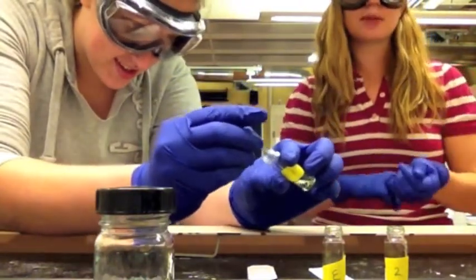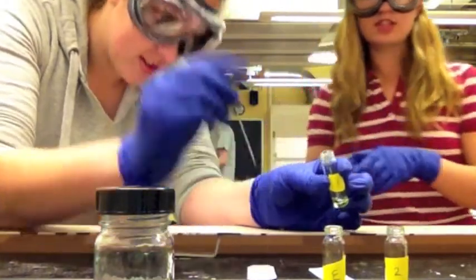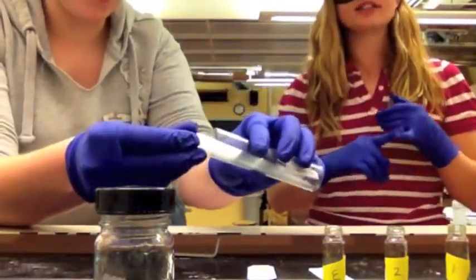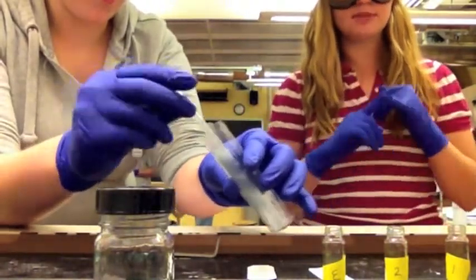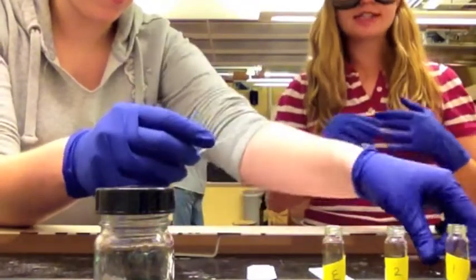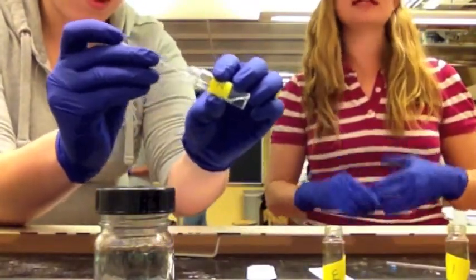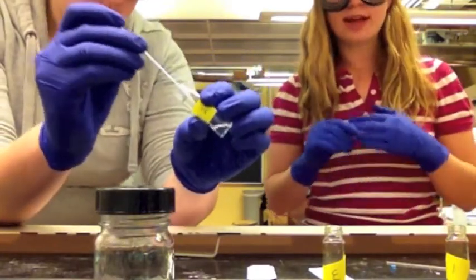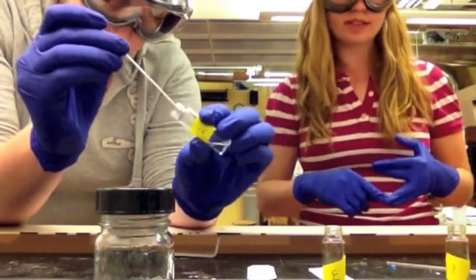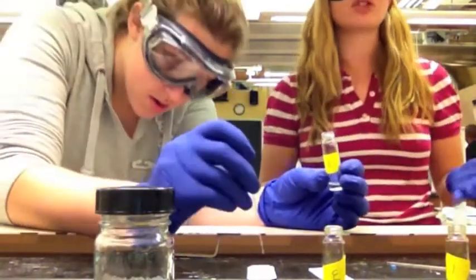This procedure can be repeated for all three samples. So, while she is finishing dyeing the plate, let's talk about what each sample is. Our dot one is fluorenone. That's the yellow color. Our second sample is fluorene. And our third sample is a mixture of the two. So ideally, in samples one and two, we will see one dot. And in sample three, we will see two dots because it's a mixture of two compounds.